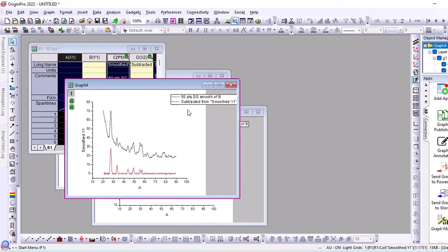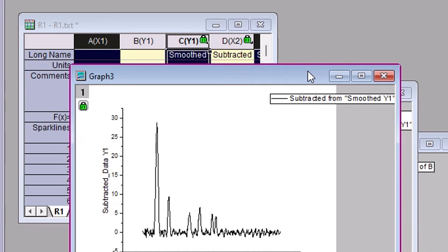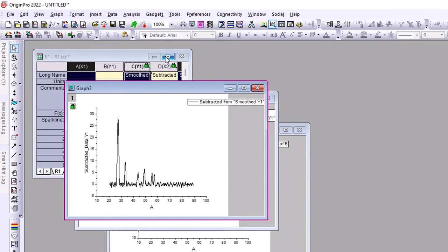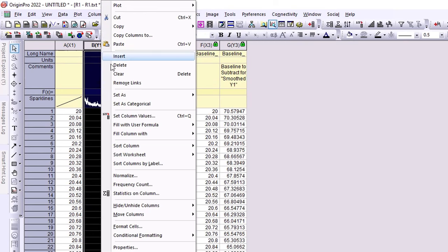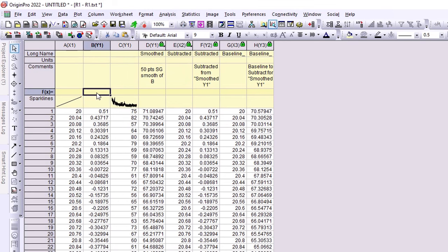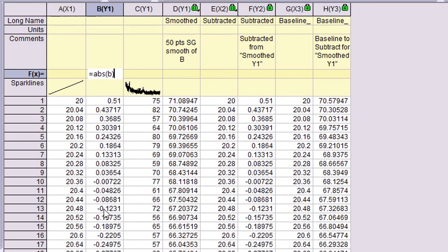Now I am going to copy the values. Since this line is correct, I will copy this column and click insert and paste the values. I will apply this formula, ABS, absolute value, to convert this data from the B column.